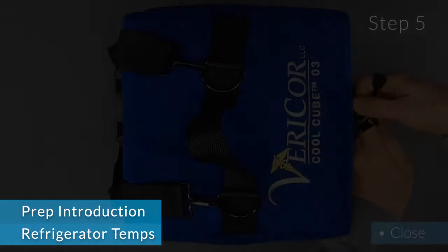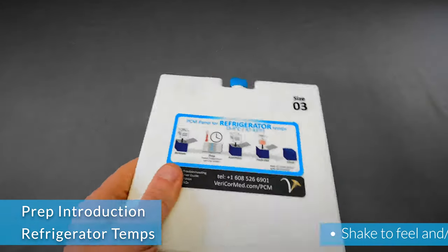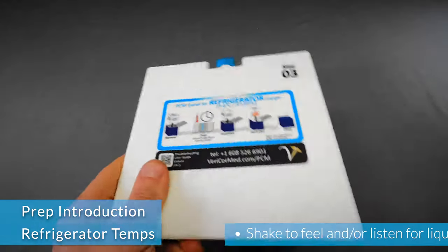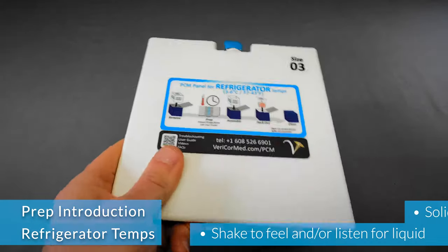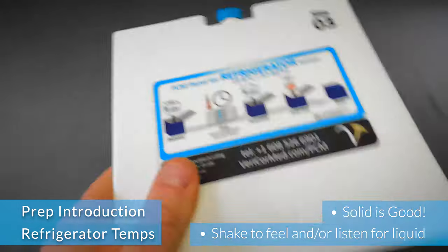A common question is, how do I know when the panels are ready to be put into the CoolCube? The simple answer is when the PCM inside the panels is solid.